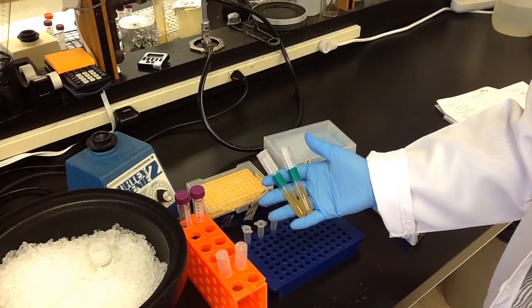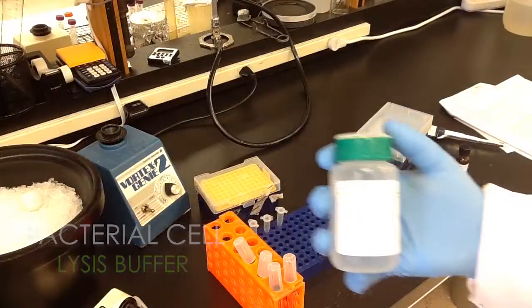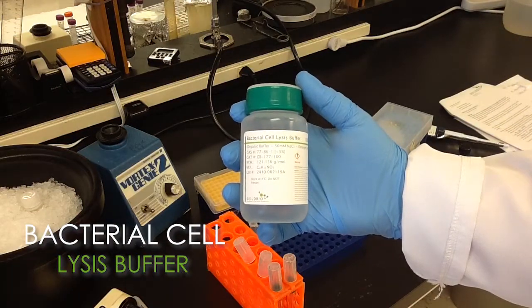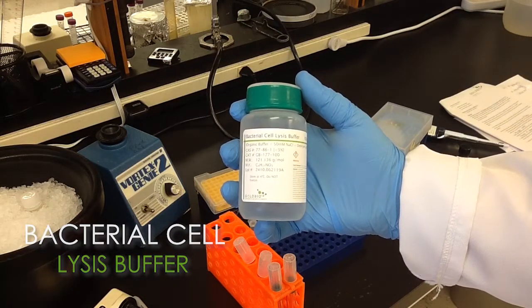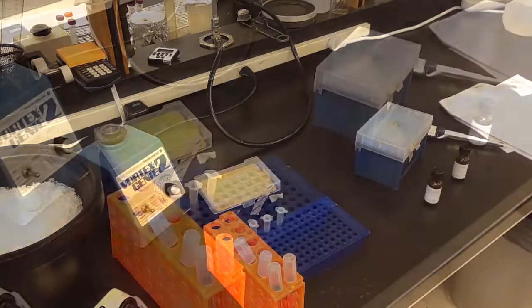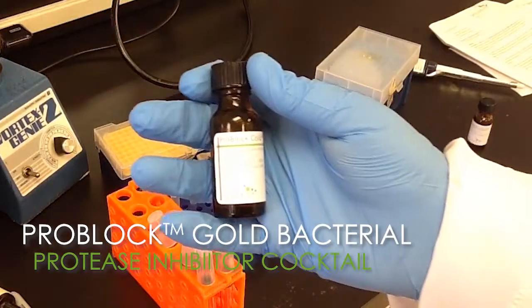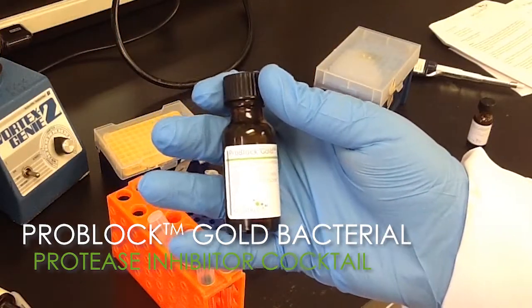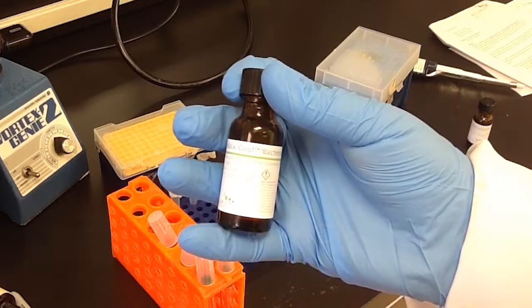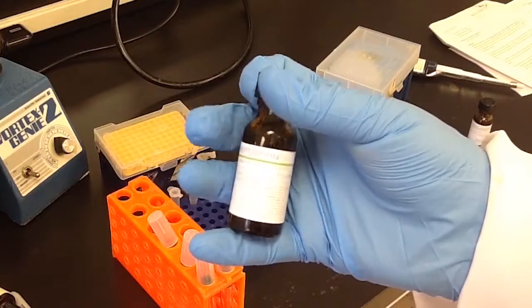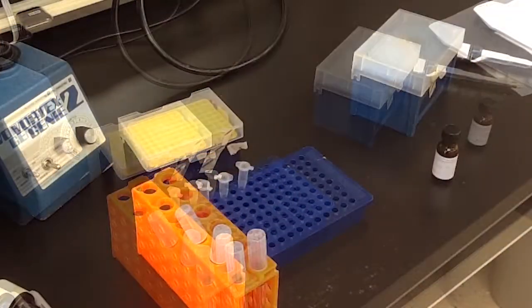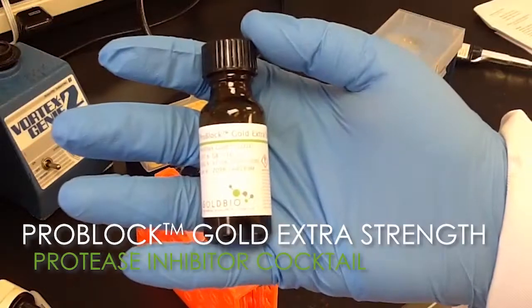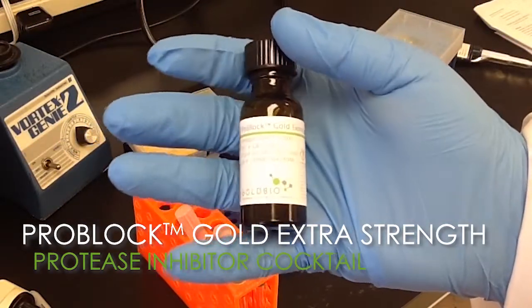I'm starting out with two bacterial cultures that I grew overnight. I will also be using our bacterial cell lysis buffer. There are two types of protease inhibitors that I will mention today. One is a bacterial protease inhibitor. The other is an extra strength ProBlock protease inhibitor that can be used as well.